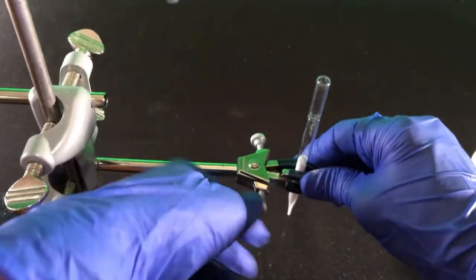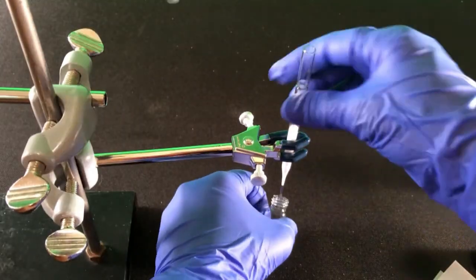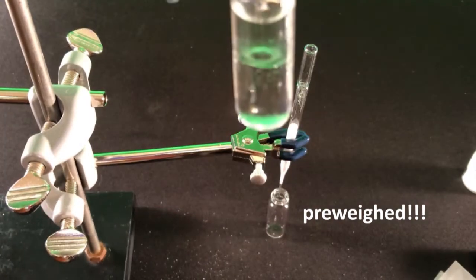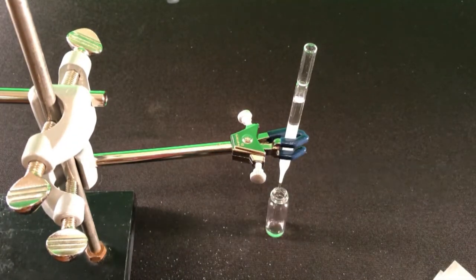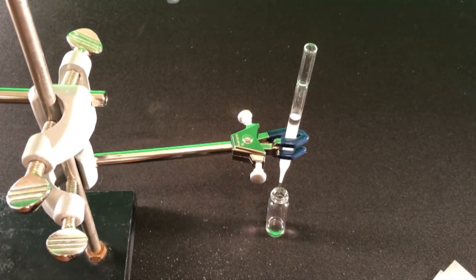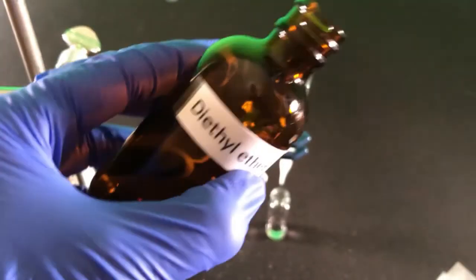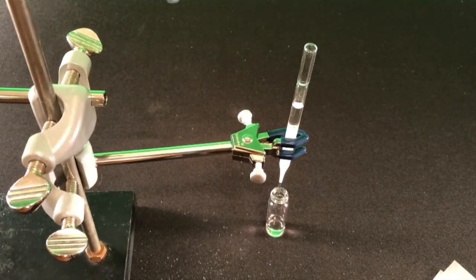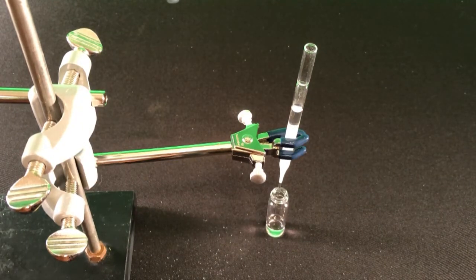Clamp the drying column onto a stand and pipette the organic layer into the column. Make sure a pre-weighed screw cap vial is underneath the column to collect the product as it elutes. Pipette the organic layer and only the organic layer into the drying column. Once the solvent has been collected, rinse the drying column with approximately 1 ml of diethyl ether to remove any product that has stuck to the surface of the sodium sulfate.